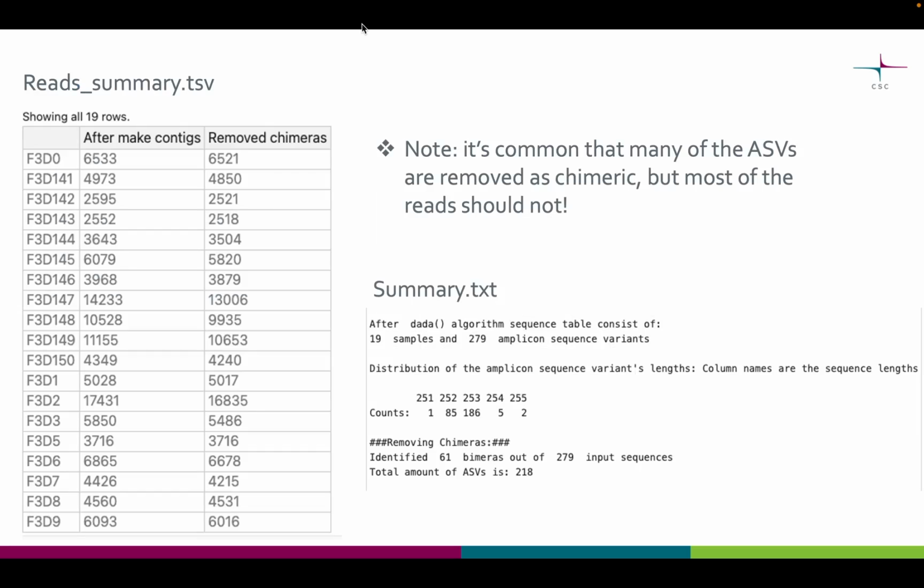Then finally you will get two summary files. From the summary text file on the right side here, you can find how many unique ASVs the ASV table contains, how many ASVs were removed as chimeric, and the distribution of the lengths of the ASV sequences. As a sanity check, you can check that the lengths look as wanted. Here the sequences were from the 16S V4 amplicon region, so the read length of around 250 looks great and very reasonable.